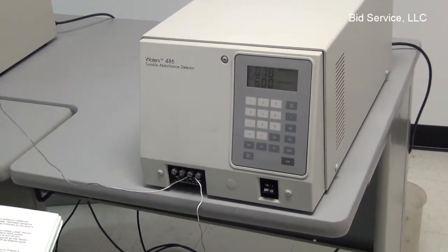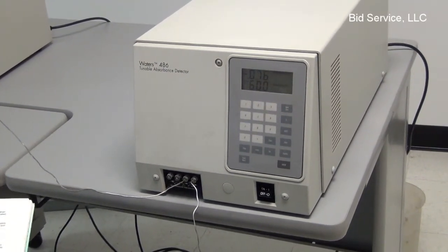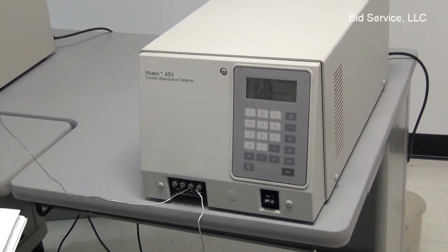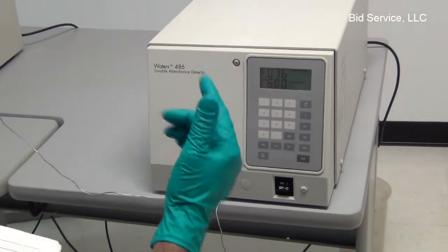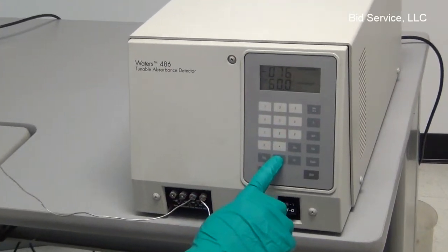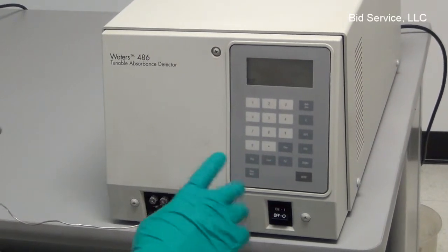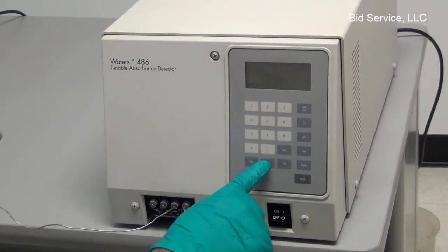The detailed user manual will be included with the machine. Now the scan is complete. I am going to show how to turn off the lamp — press the lamp key, the lamp is off. Whenever you want to leave the system in standby mode, it is better to turn off the lamp to save the lamp life.